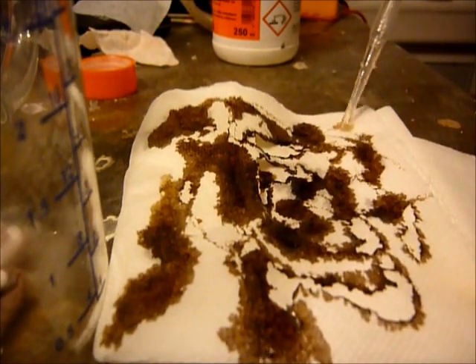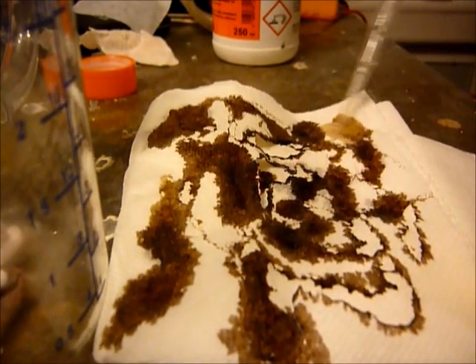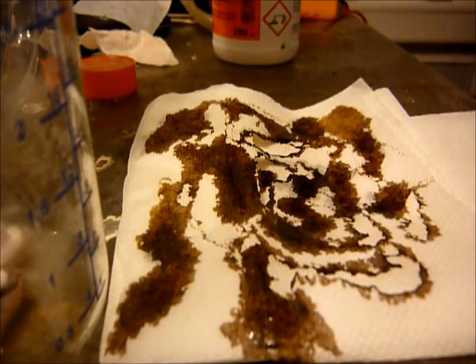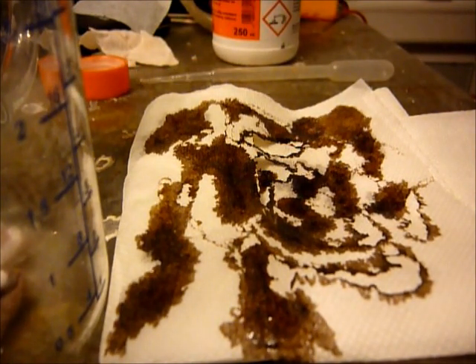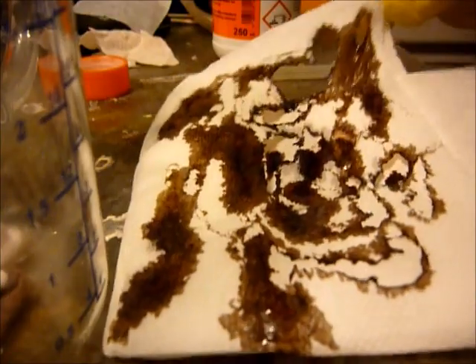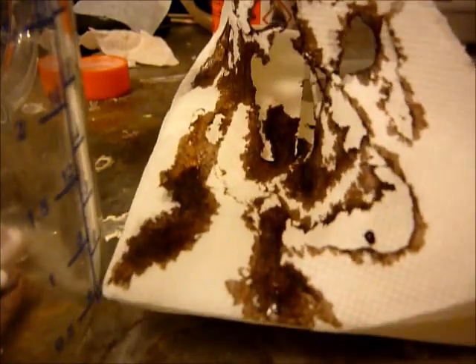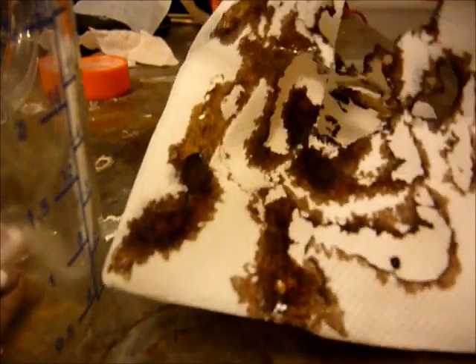So you will see a very vigorous reaction if I add more. So the paper is etched by the sulfuric acid.